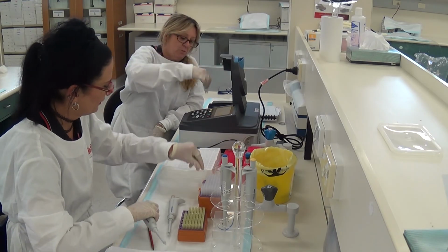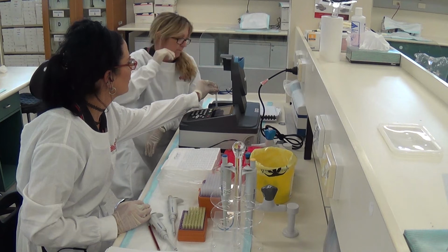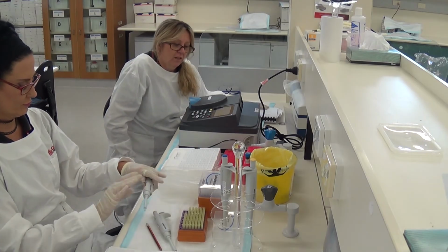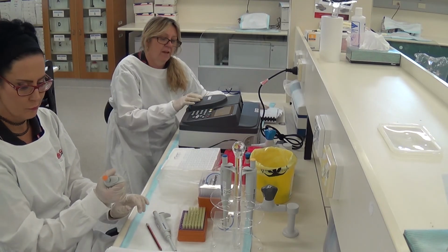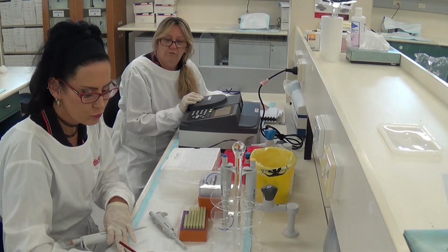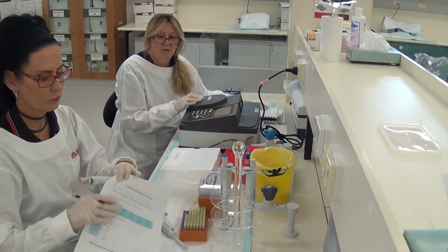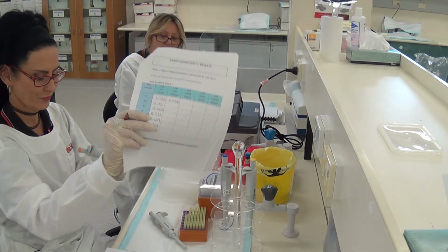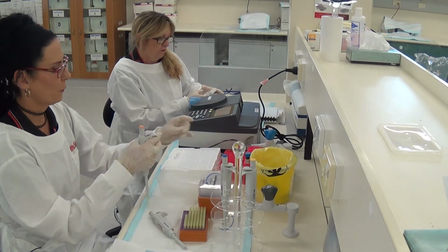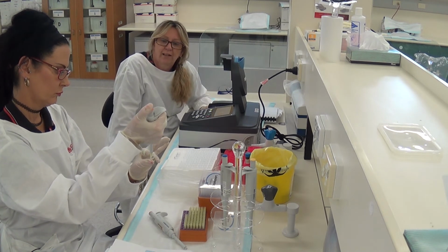Okay, so we're going to put that into the spectrophotometer and we're going to check it at time 0 after we mix it. Okay, so on our live timing, our absorbance at time 0 is 0.036. So if you can write that in for time 0 for your 0.5 molar, as Kat's done. Okay, and now we're going to go ahead and add the enzyme. Then we're going to start timing it for that 3 minutes again, okay? So 10 microlitres of our active enzyme ADH.